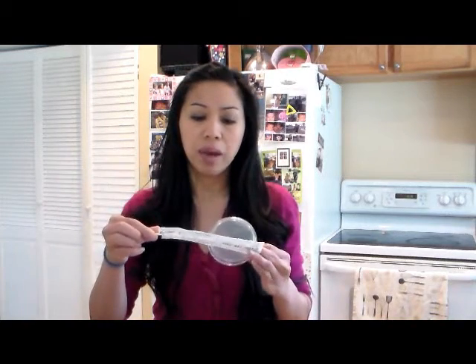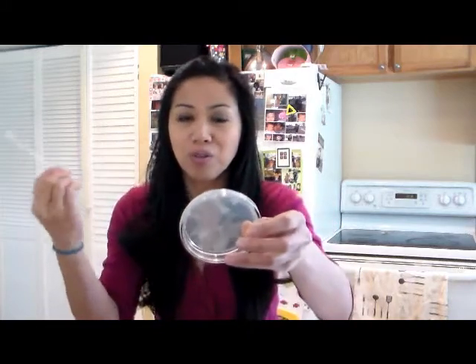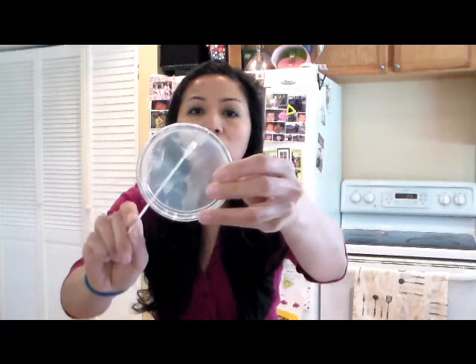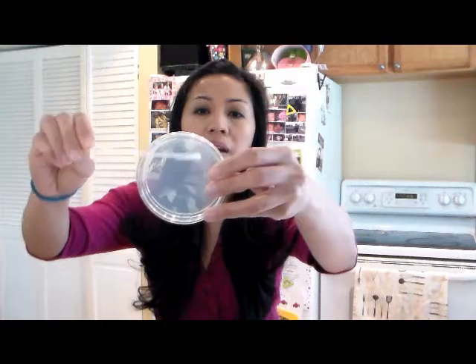The ones I ordered came with about 20 swabs. What you'll do is swab whatever you're testing — a cell phone, a sink — and then smear it onto your agar plate. I'm not going to open this one, but the technique is like a zigzag, back and forth the other way. And that's it.